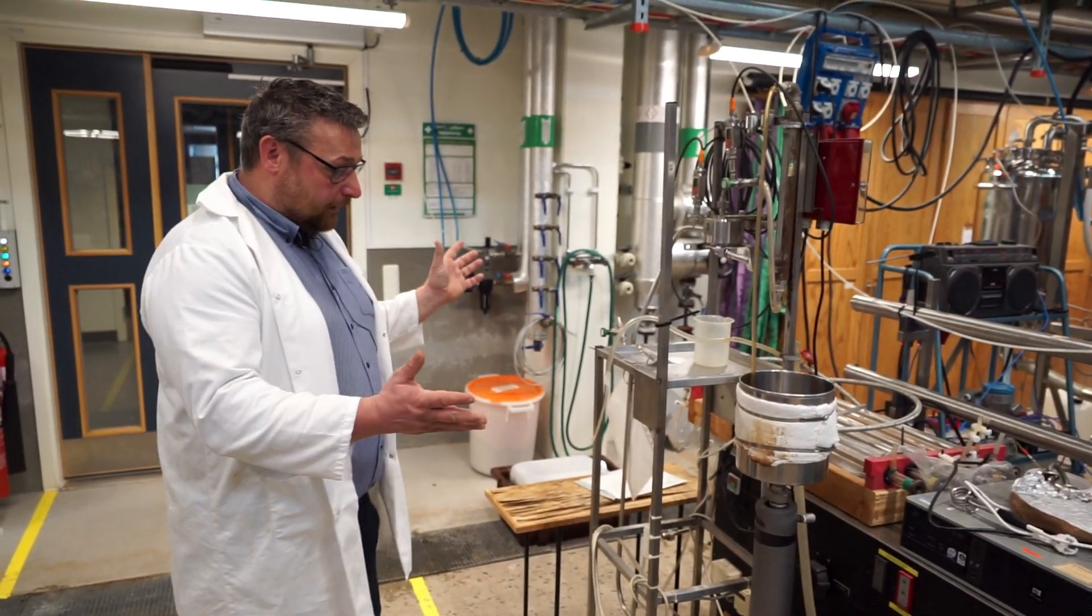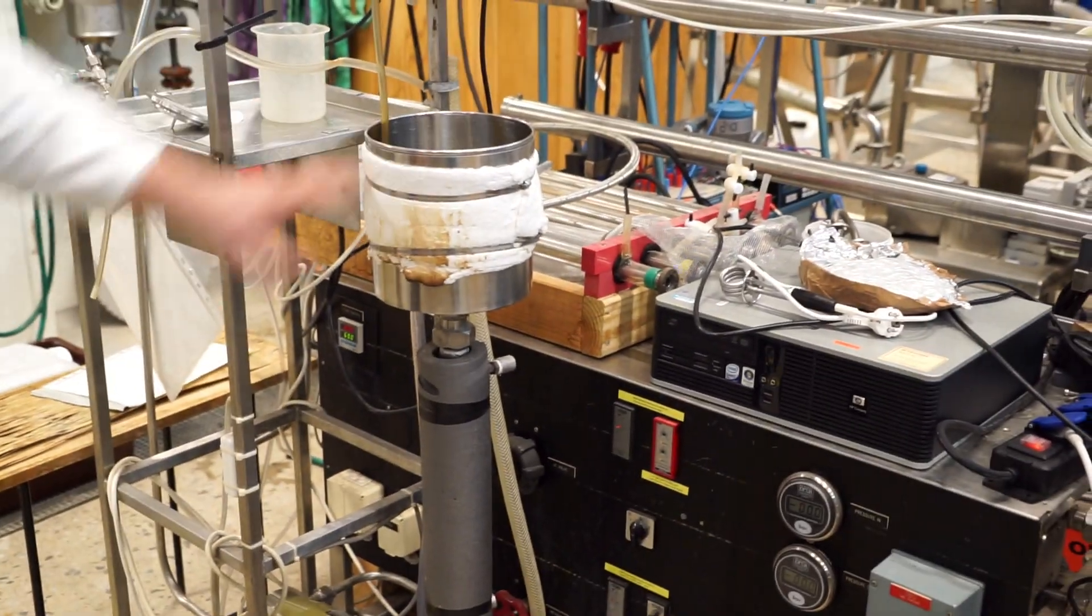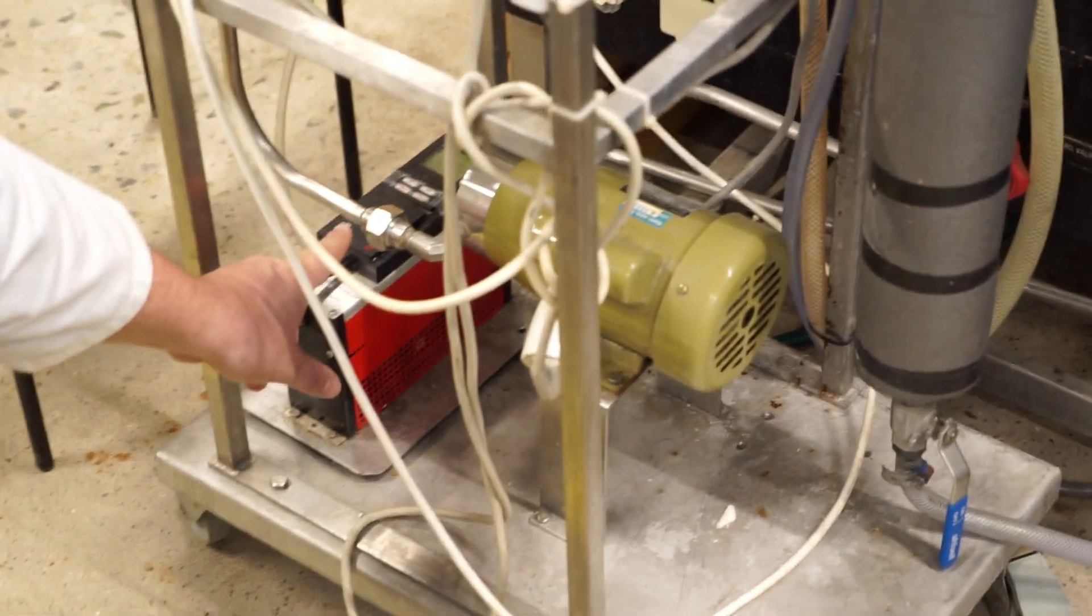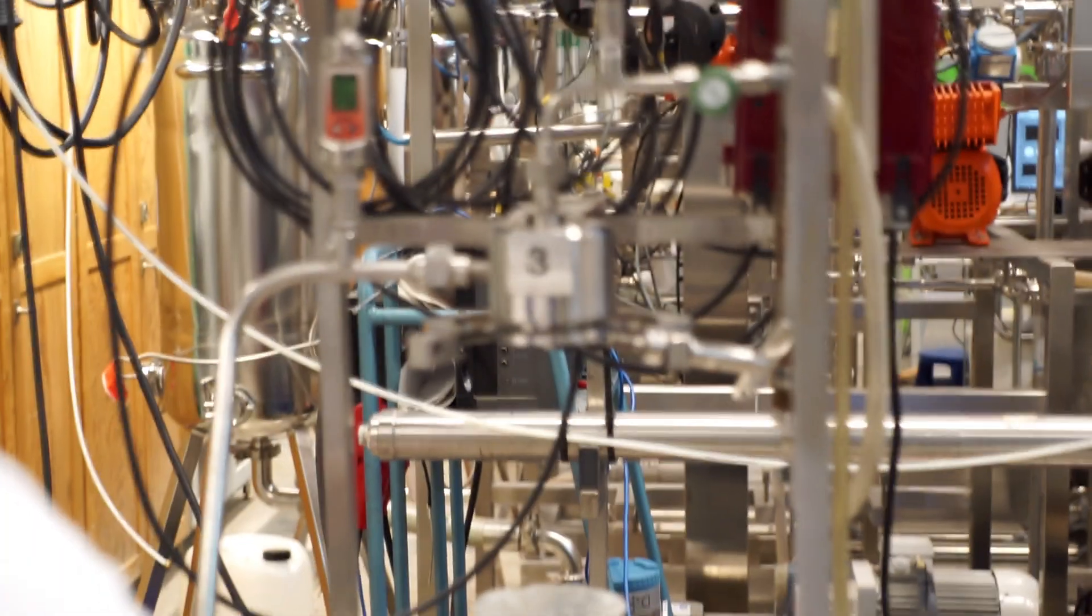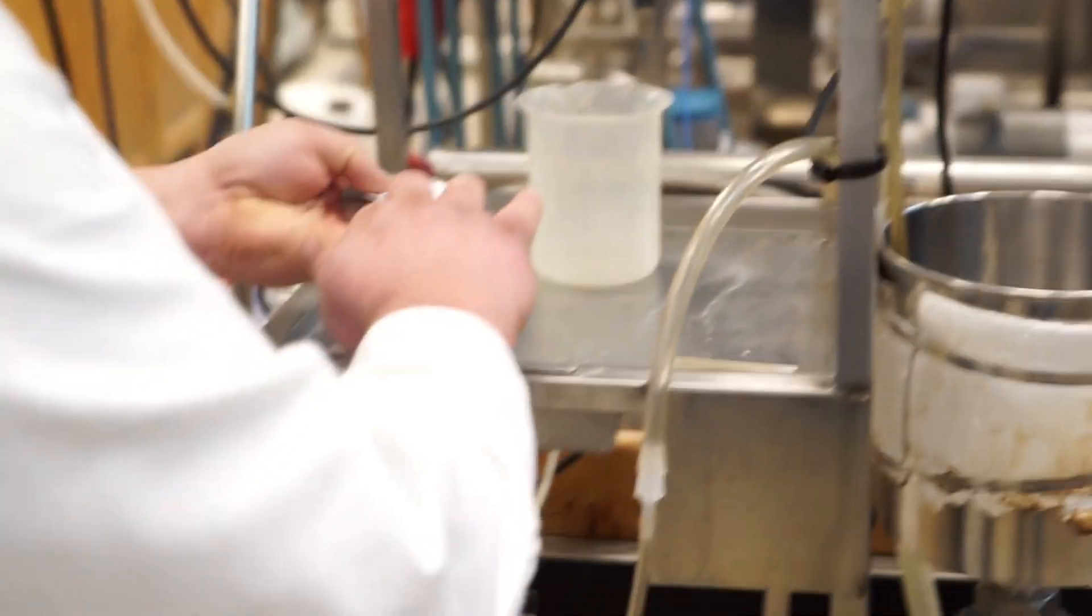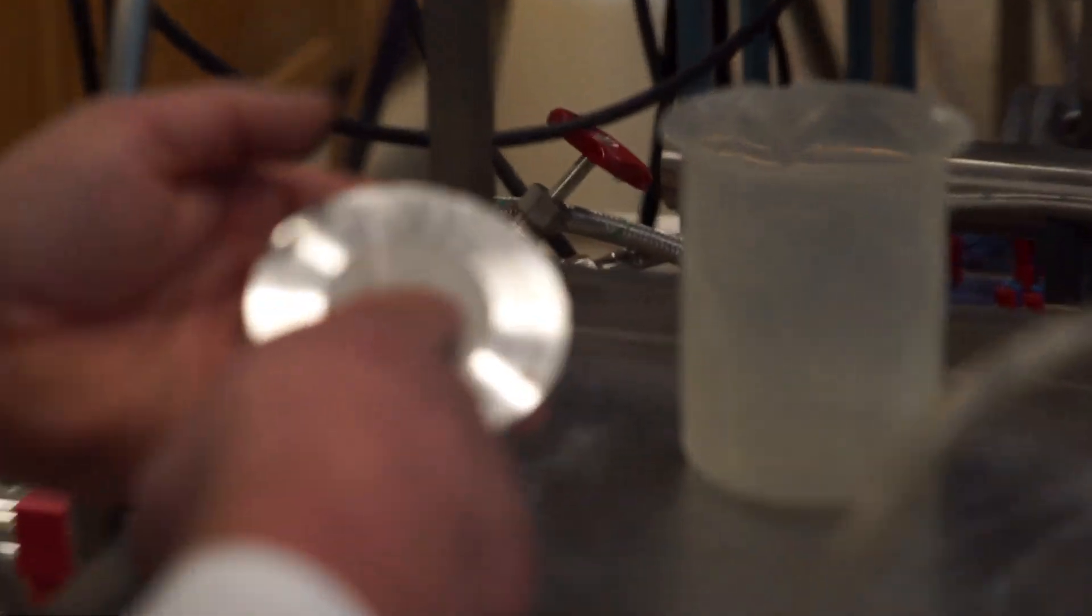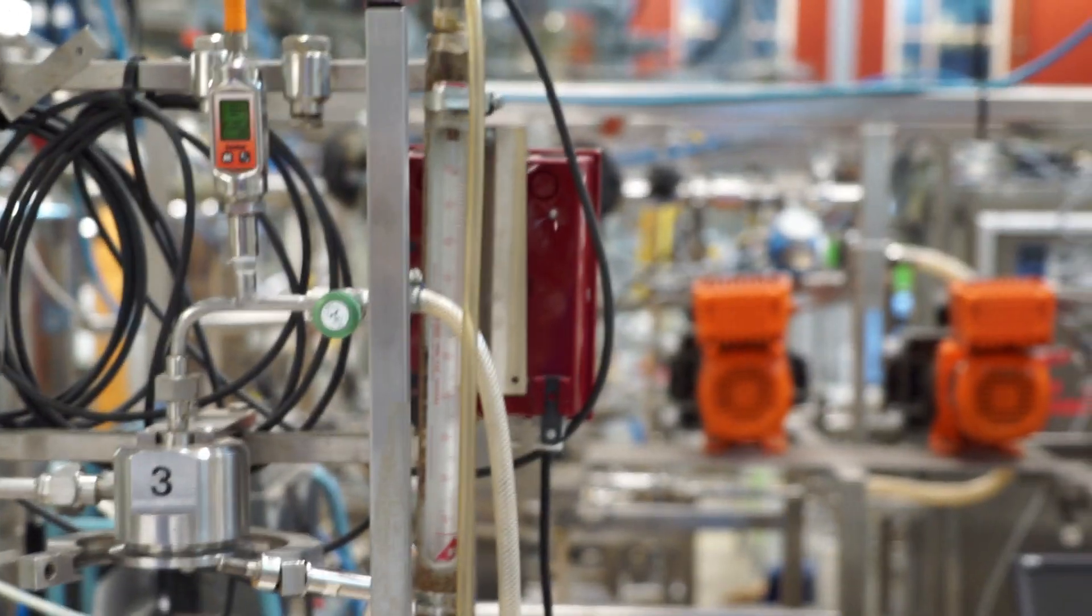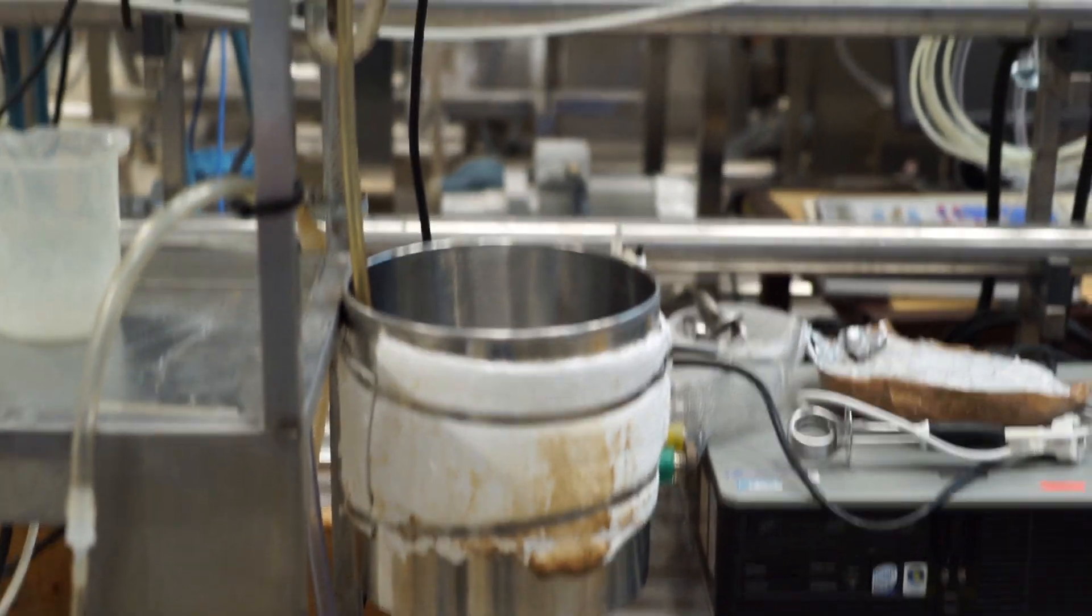So the system basically is a tank, tube down to the pump, which is controlled by a frequency converter, a line up to the membrane module and the membrane, which I will soon mount, sits here on a porous plate. And then you put that there. I will put that there later on. Flows across the membrane and through a flow meter and back into the feed tank. Yeah, we are circulating. This is a total recirculation setup.